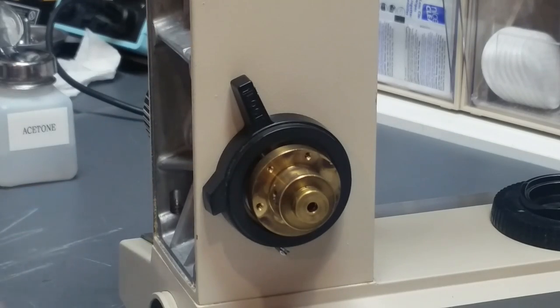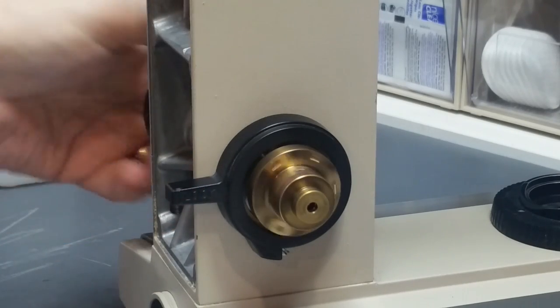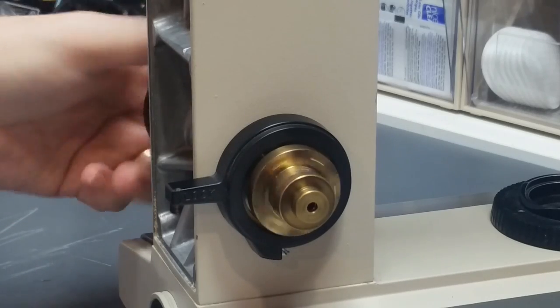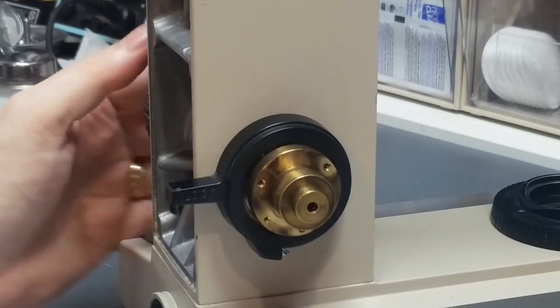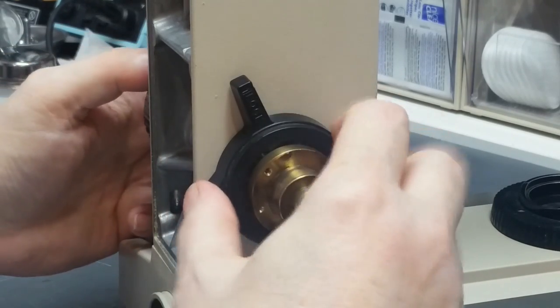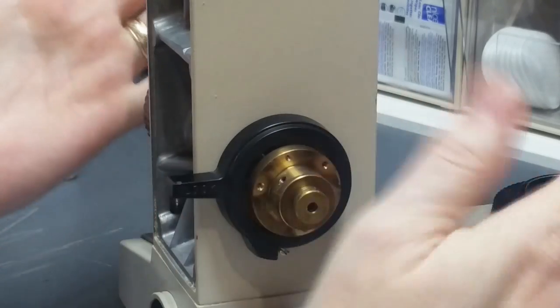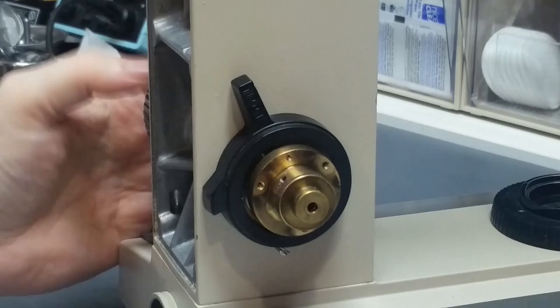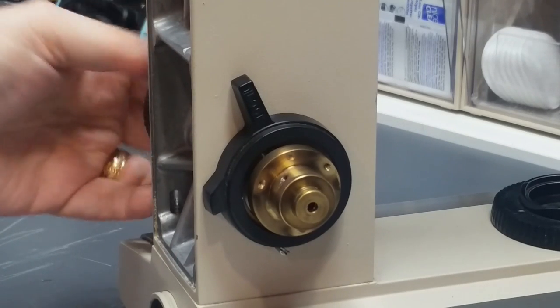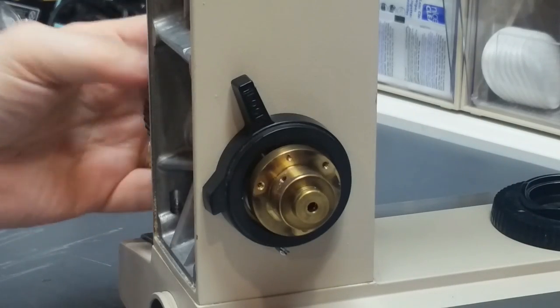Okay, so what I'm going to do now is check and make sure that preset stop mechanism is actually working. Ordinarily, when this is loosened up, this thing will just spin forever. So what I want to do is lock it down. Put it at some position, doesn't matter where. Lock it down, and at that point, if I rotate this knob on the back side, it's stopped by the pin in one direction and it'll still go in the other direction.